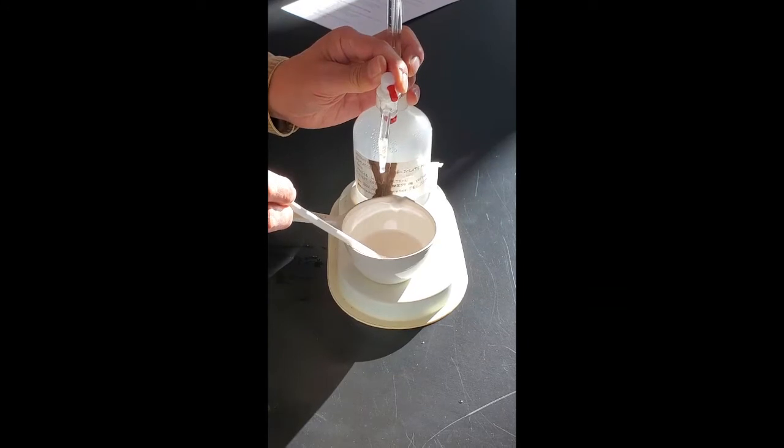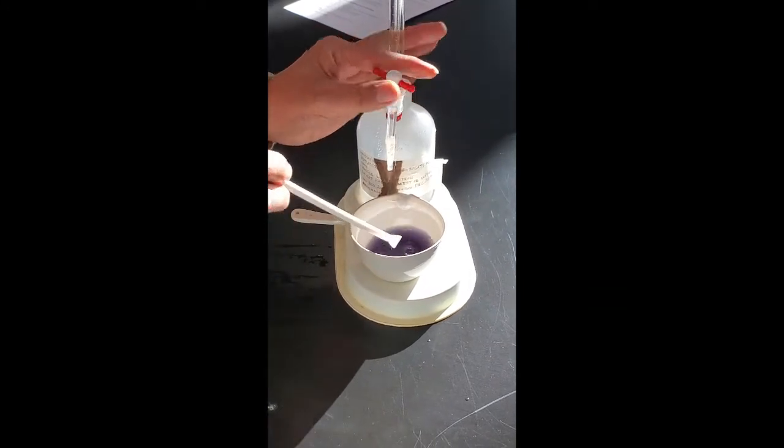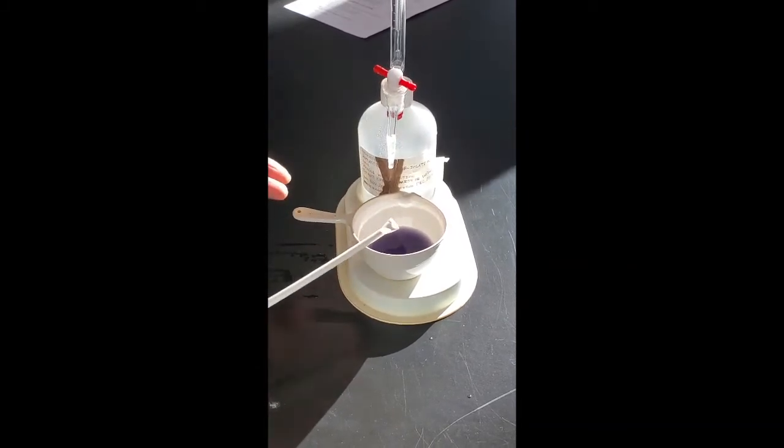So let's do it a little bit slower. One drop, two drops... oh, you see, one extra drop, the whole thing changes color. So that is my endpoint.